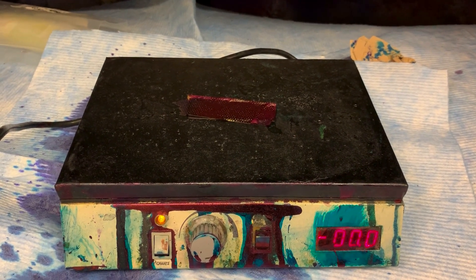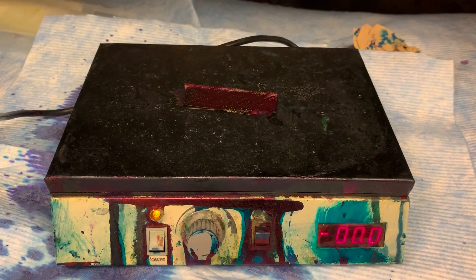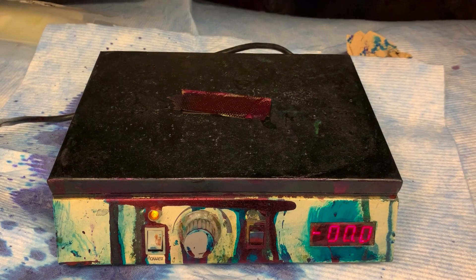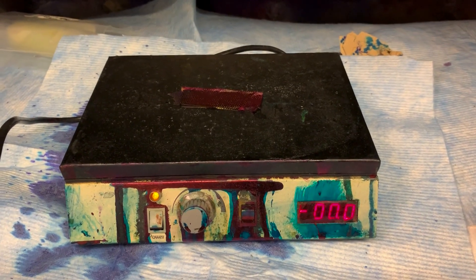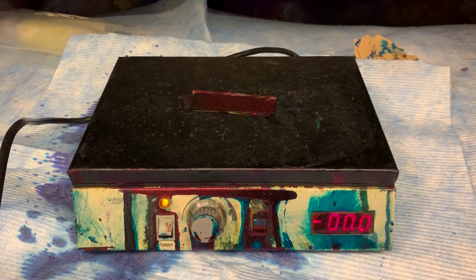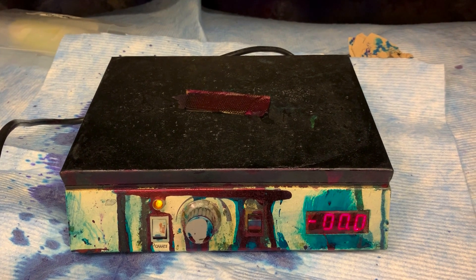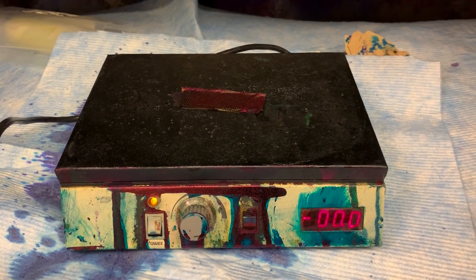I don't know if you can see, but there is actually steam coming off of it right now. I'm doing this in the microbiology prep room in one of the fume hoods because this is quite pungent and I don't want to stink up a whole lab. So I'm going to take this slide back into the micro lab and do the final steps for the acid-fast stain.